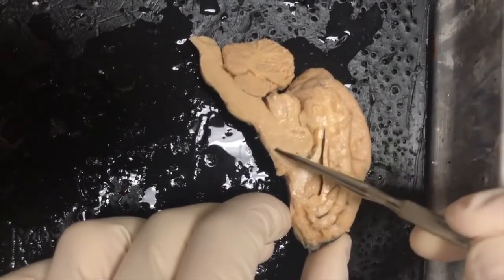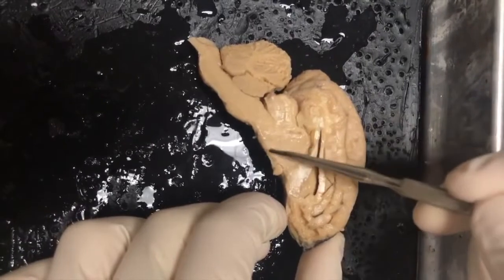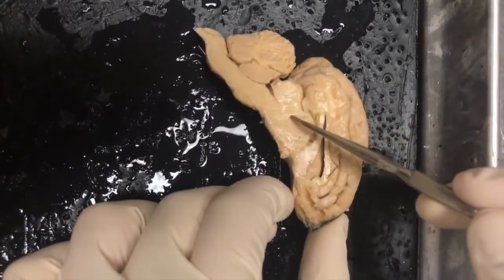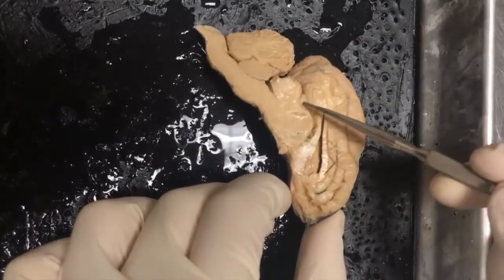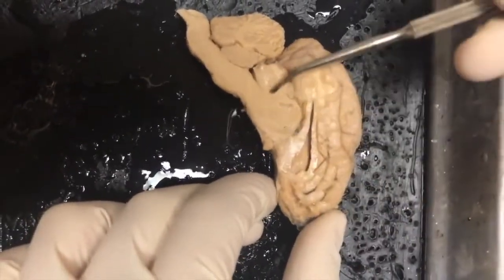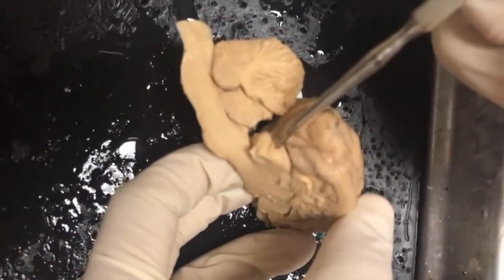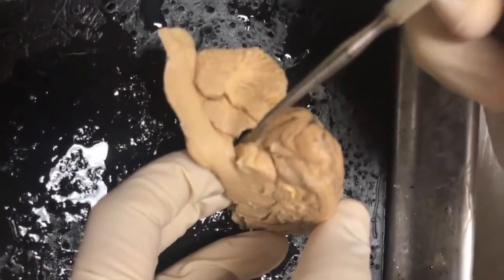And then below that, you have the hypothalamus, and that's where that is. Moving above the thalamus, so here's the thalamus, moving above it, you'd have the epithalamus, which is more commonly known as the pineal body or pineal gland. Moving more posteriorly, we could see another view of only one of the superior colliculus and the inferior colliculus.